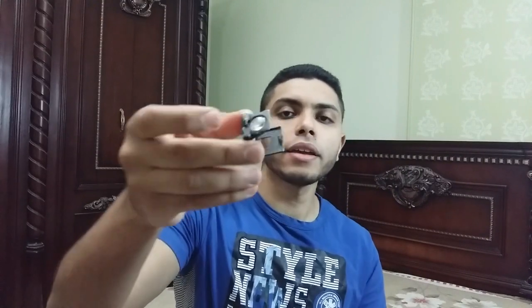Anyway, today I'm gonna use this micro mic — micro what — micro telescope — microscope, you idiot. I will try to connect this into my smartphone and we will zoom some stuff.